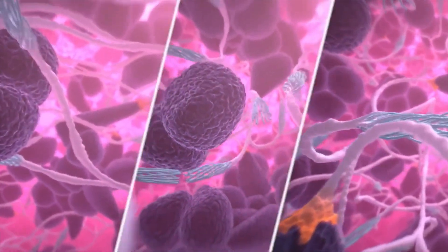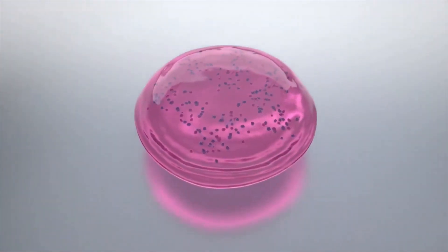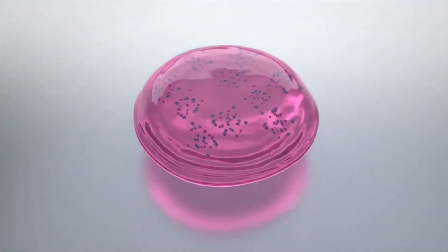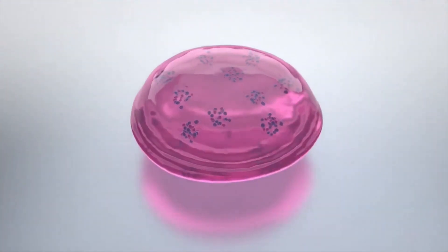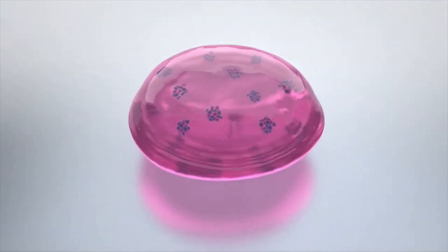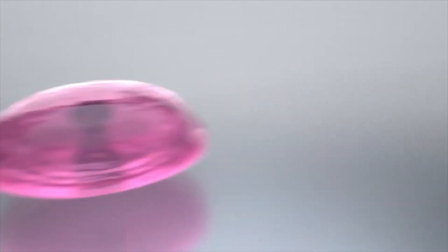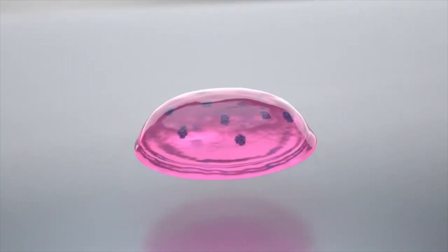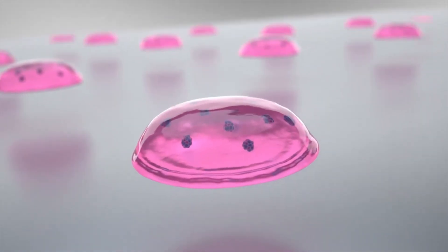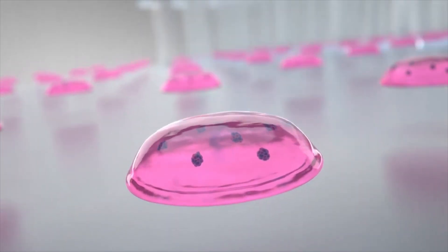With exquisite control over 3D structure, the cell models enabled by Rastrum are limitless, from simple embedded spheroids to complex co-cultures. Whatever the model, Rastrum delivers a step change in speed and reproducibility.